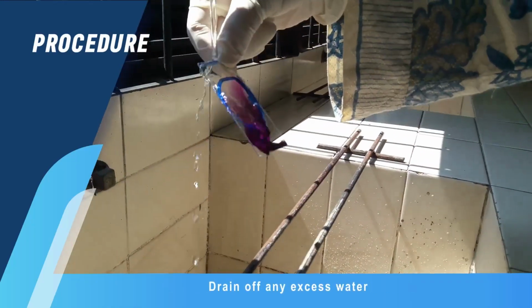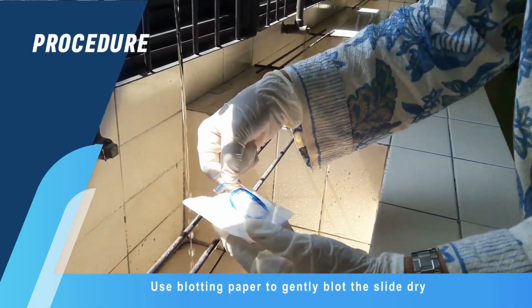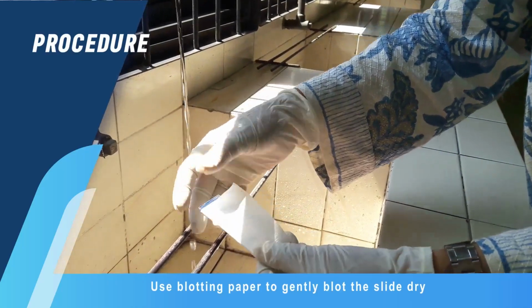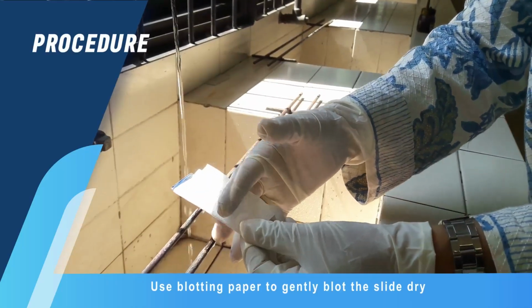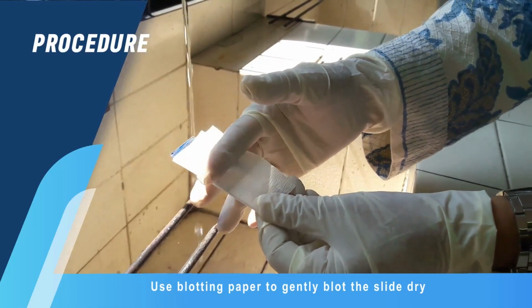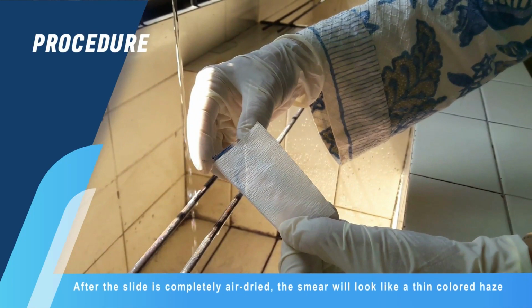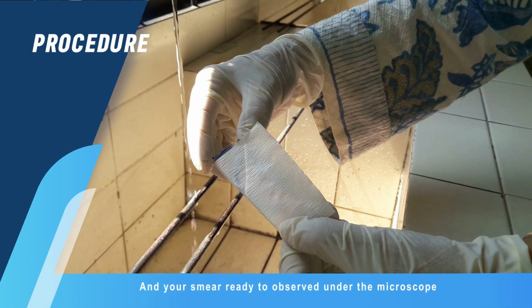Drain off any excess water. Use blotting paper to gently blot the slide dry. After the slide is completely air-dried, the smear will look like a thin colored haze, and your smear is ready to observe under the microscope.